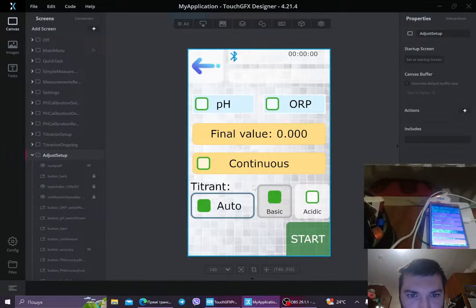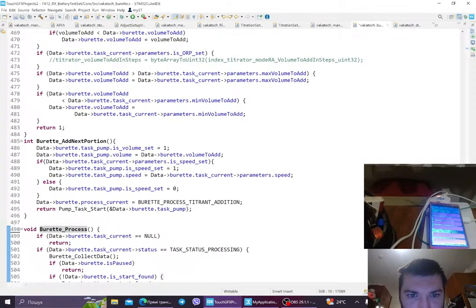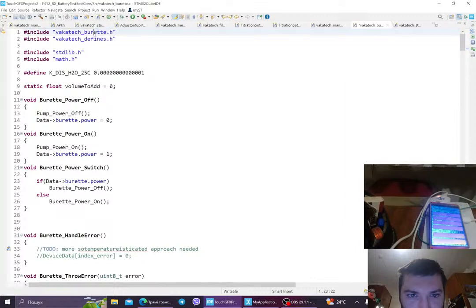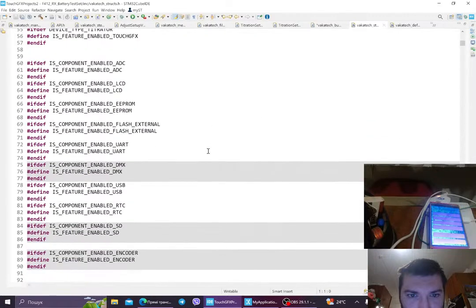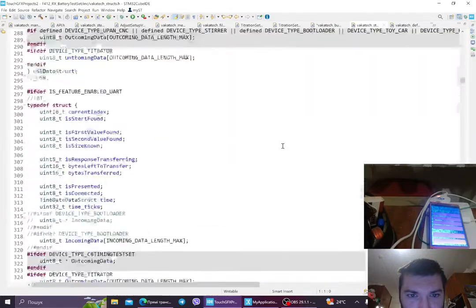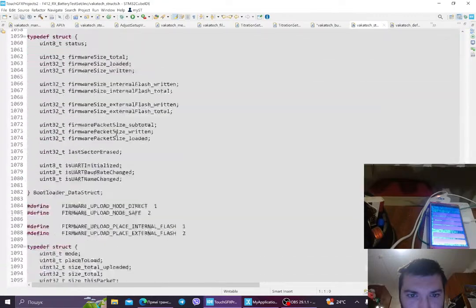So the user has to specify the titrant. And of course this titrant should have some properties such as acidity, the formula, the titer, and so on, many of them. And if you're interested, where do I keep all of my definitions, I have the header for it, Wakatek structs, and here we have titrants, this is for the step motor, and I believe it's lower.